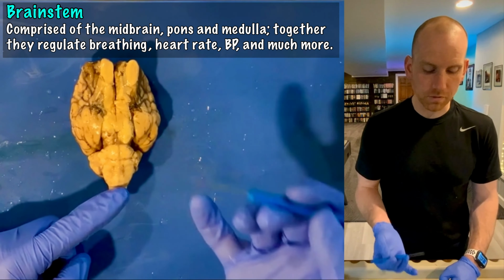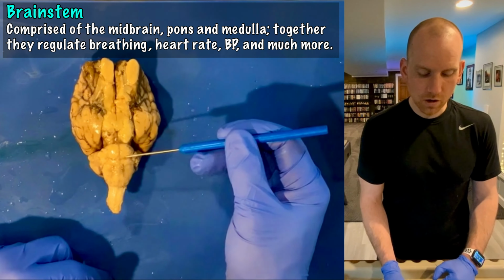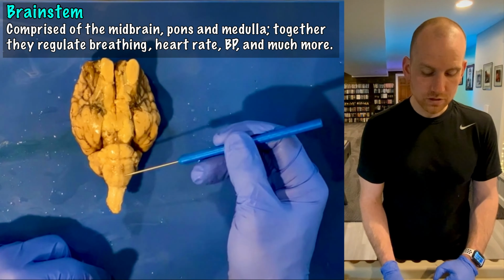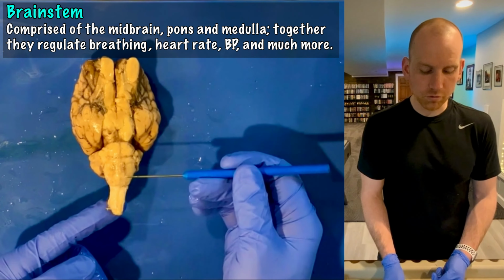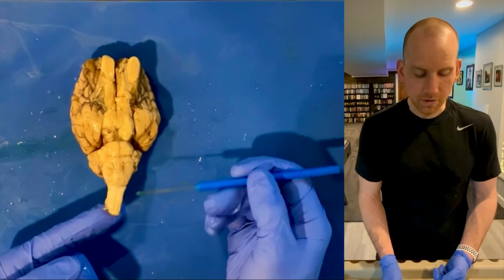And the brainstem is made up of three components. It's made up of the midbrain here, and then there are really two big humps. There's the pons and there's the medulla oblongata. So we've got midbrain, pons a little bit lower, and the lowest portion of the brainstem is the medulla oblongata, located right underneath the cerebellum.